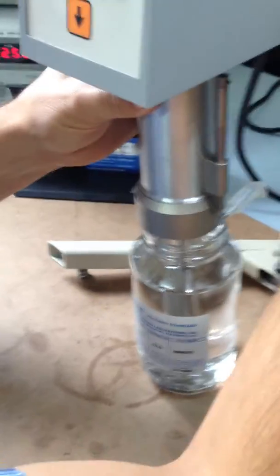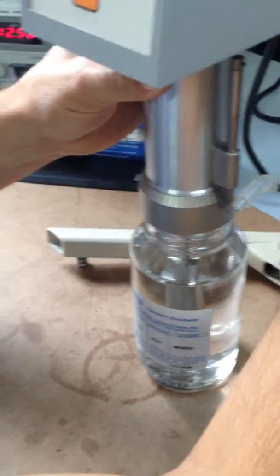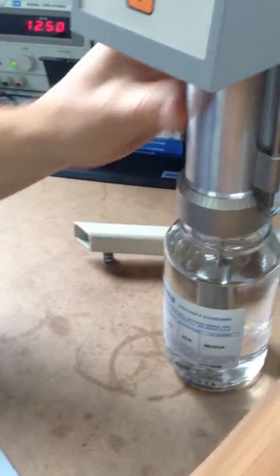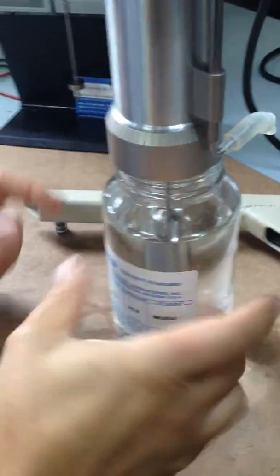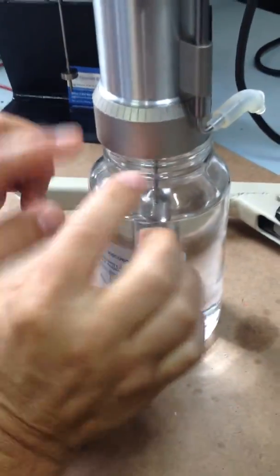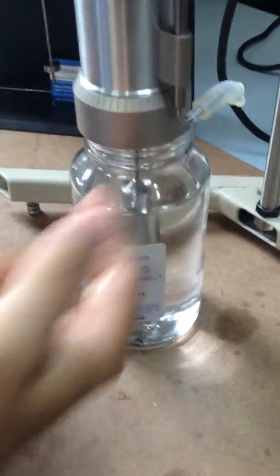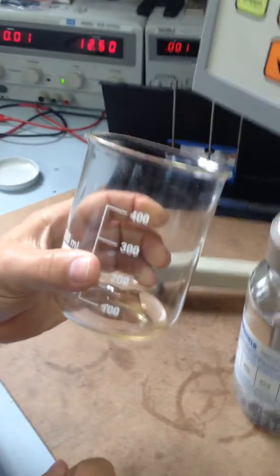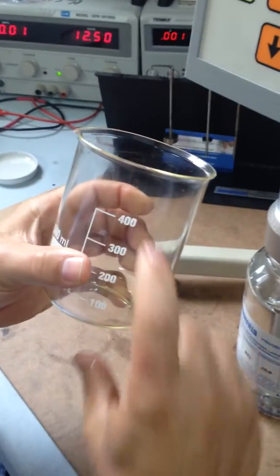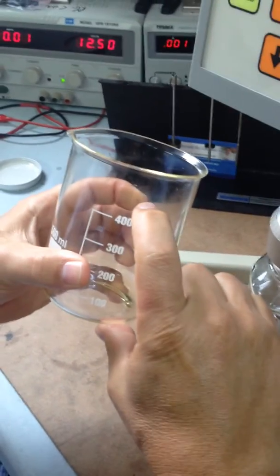You got to be looking at your mark. Right now the way it sits in, it's almost at the level here. When you're going to do your product, you're going to be using this and you're going to fill it up.